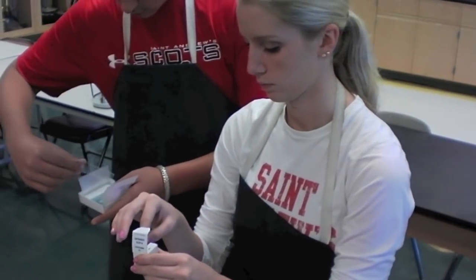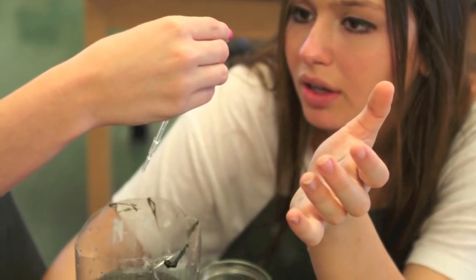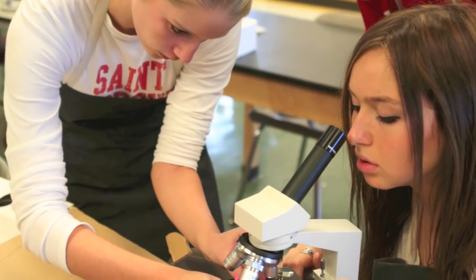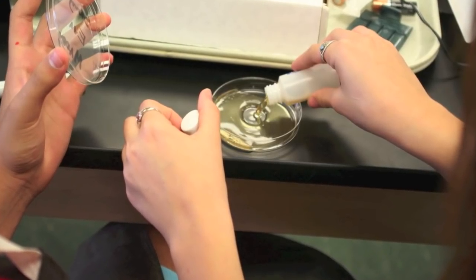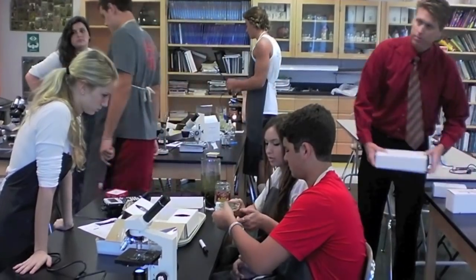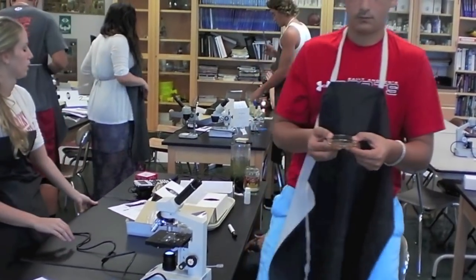One of the last tools we're going to use is a specially designed fecal coliform study where we'll put water samples inside petri dishes, allow them to grow, and then based on the number of colonies and the color, we'll actually be able to determine what the level of fecal coliform is inside the pond.